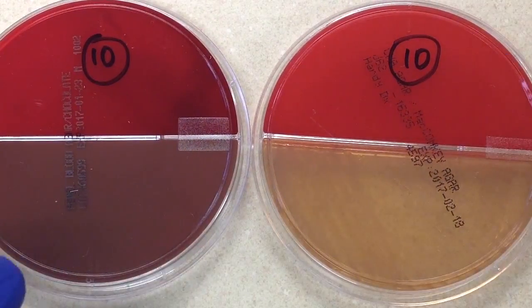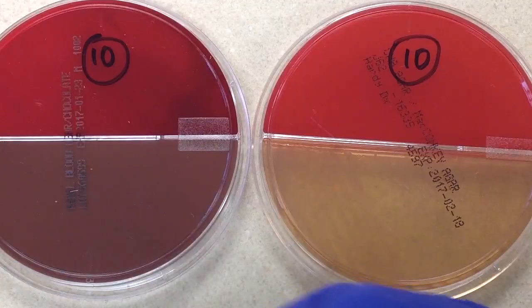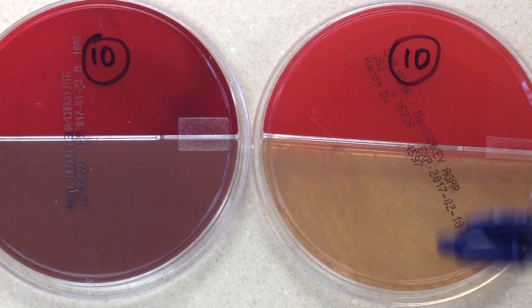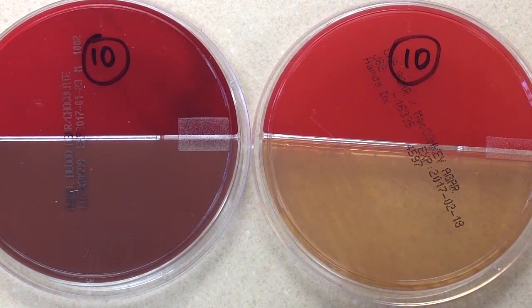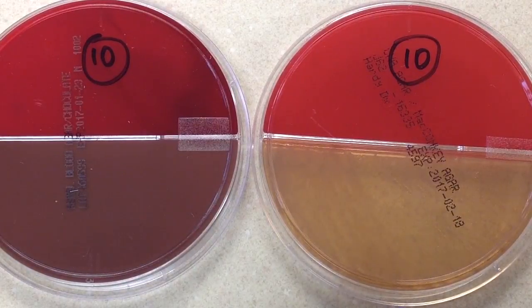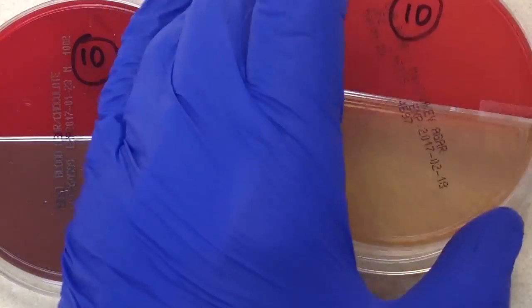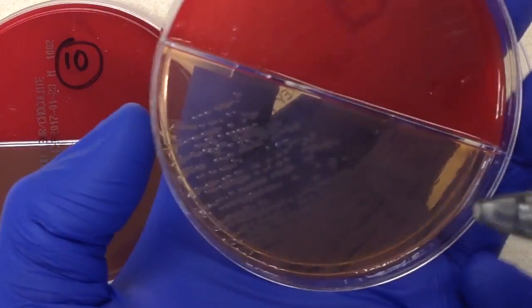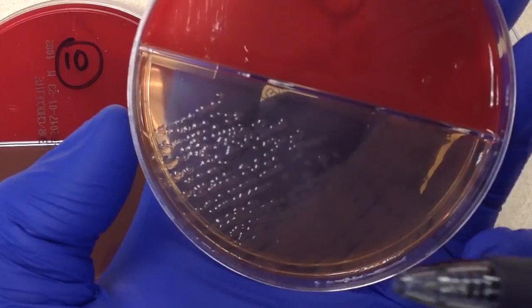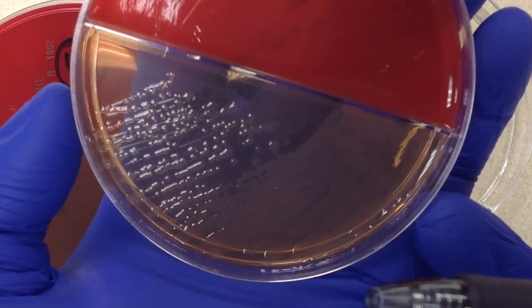So what do we do with this? This is pretty straightforward. Whenever we're working with gram-negative rods, the first test we perform is an oxidase. Some may ask why we're not doing a gram stain first — I don't need to because based on all the plates I only see one colony type, and anything growing on MacConkey's is pretty much going to be treated as pathogenic. We know only gram-negative rods from Enterobacteriaceae and Pseudomonas will grow there.